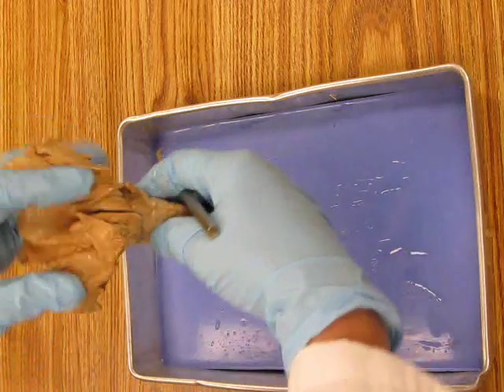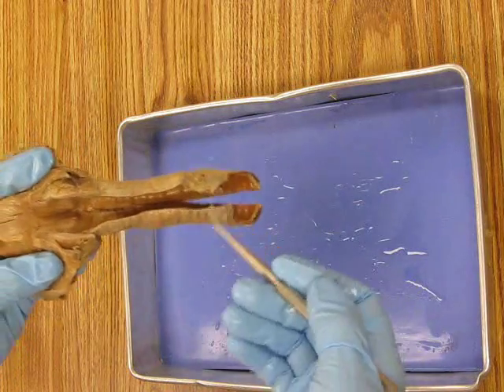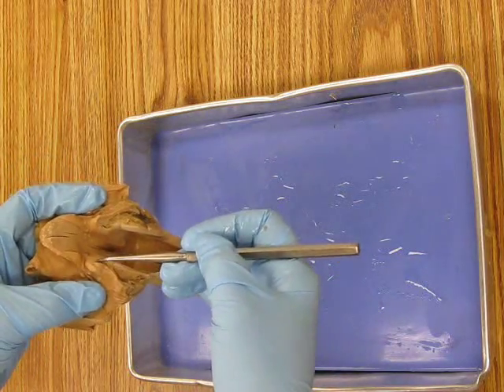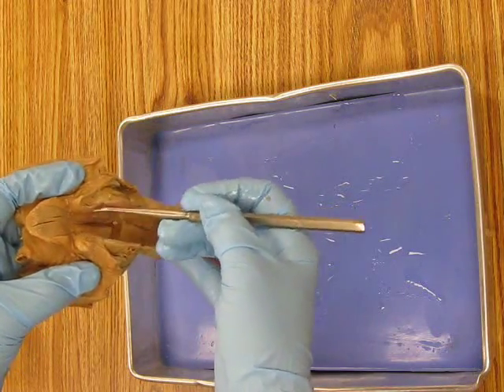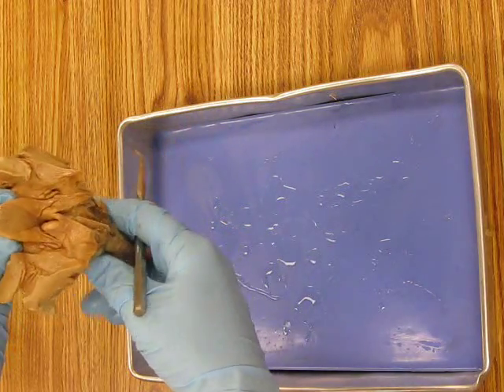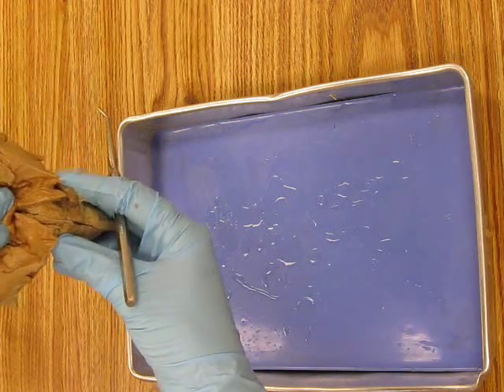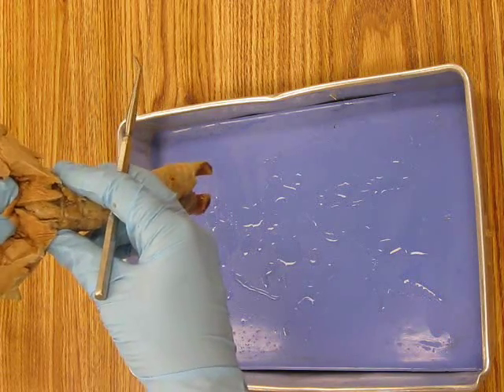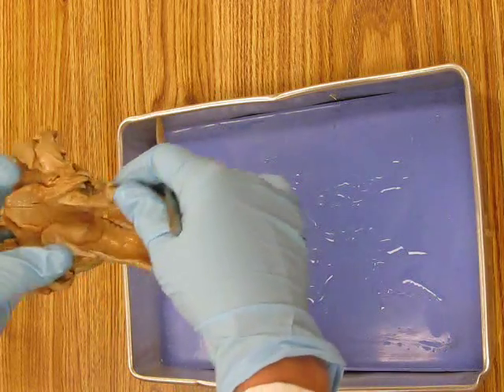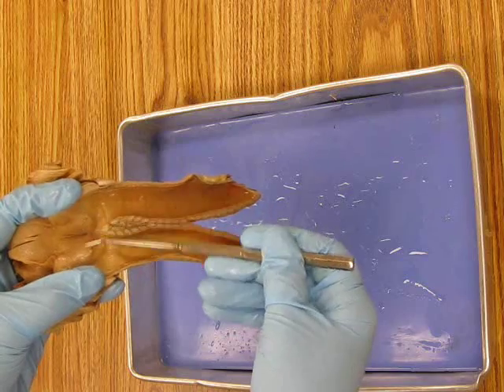Okay. Now, we have two sets of cords. One was called the true vocal folds or vocal cords, and the other is the false. The false are these two mucosal ridges at the top of the larynx, and they have no role in voice production. They just help the epiglottis form a seal as we swallow. So even though they're called vocal folds or vestibular folds, they are false because they don't actually have a role in voice production. These two bumps on the inside of the larynx, here and here, are the true vocal cords.